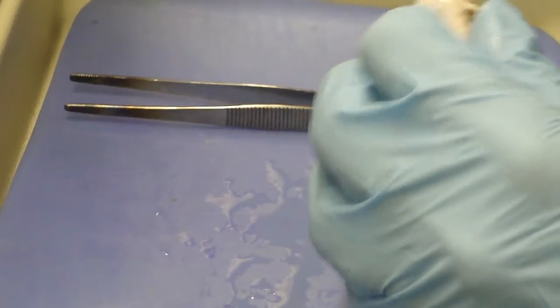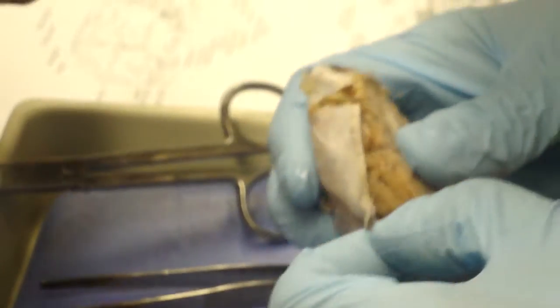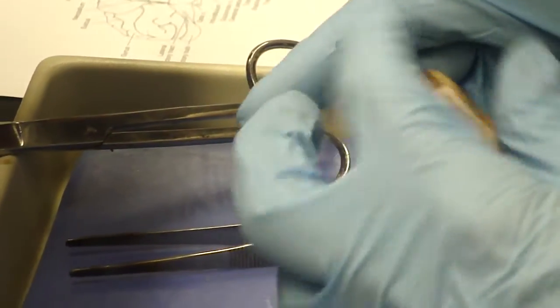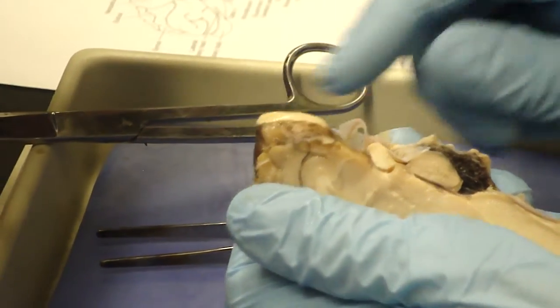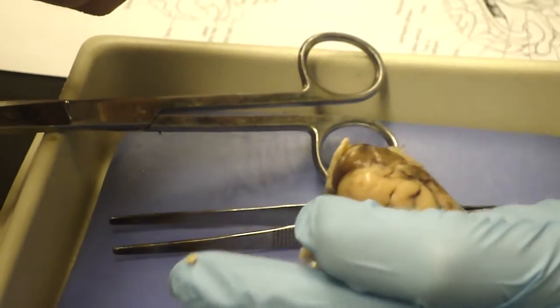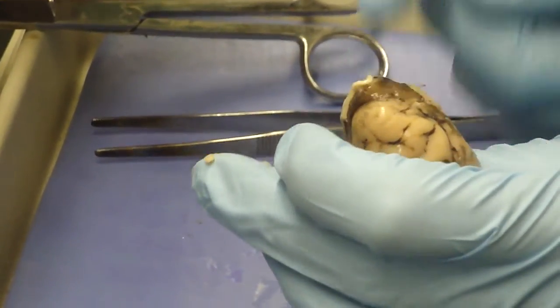Boy, is this ever tough stuff. There we go. Now I'm ripping apart the arachnoid as I do this. You can see some of the fibers there. Getting into cerebral hemispheres. Now ventrally, this is the olfactory tract right here, or olfactory bulb. This would be pressed up against a plate at the head of the brain with lots of little holes in it that the olfactory nerves go through into the olfactory bulb.